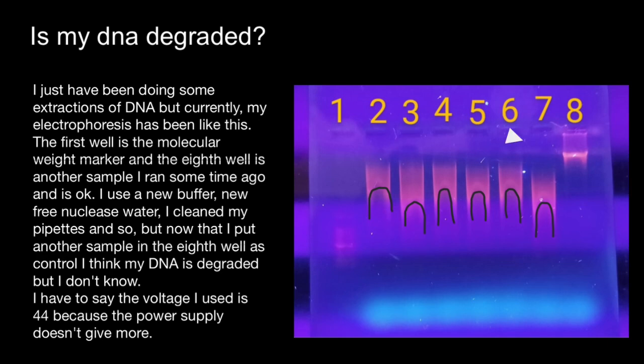And if we compare with sample number 8, we see a well-defined band. And if we consider that this is going to be the same species in the rest of the wells, we can say that here we see degradation of the DNA. You can also tell not only by the band appearance itself, but by comparing the distance the band traveled. Here we have DNA of a smaller size which traveled farther than this band. So again, this is an indication of DNA degradation.